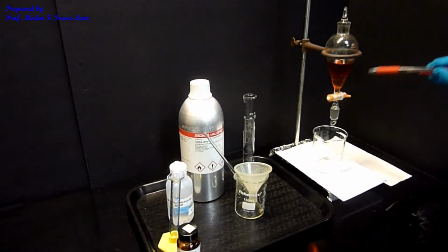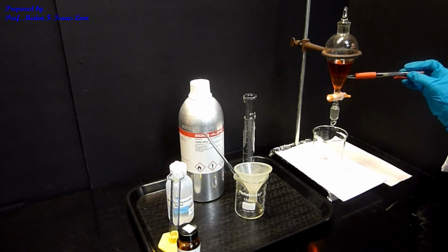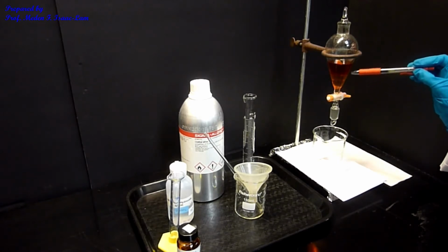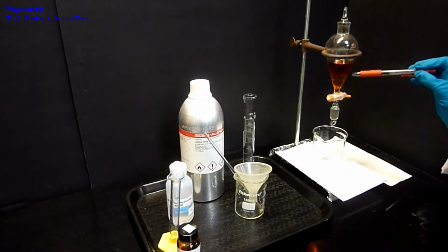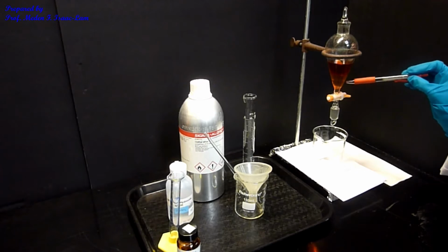So in the sep funnel, we have the lower layer containing the base and my carboxylic acid portion of my 3-component mixture. Again, the carboxylic acid is now separated from the 3 components, going into the lower layer, while my 2 other components are in the ether layer. So this is my ether layer. Remember, the ether is lighter, so it goes to the upper layer, the organic phase, and this is the aqueous phase.